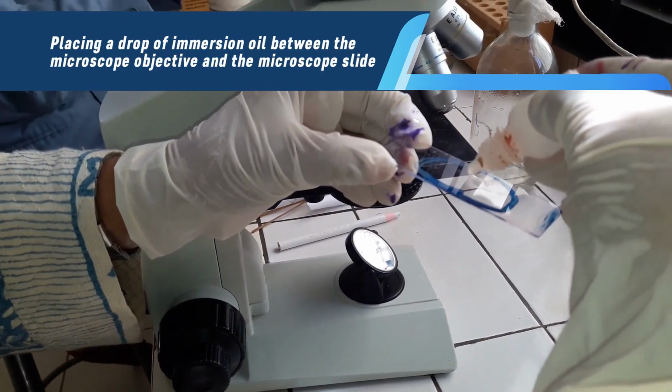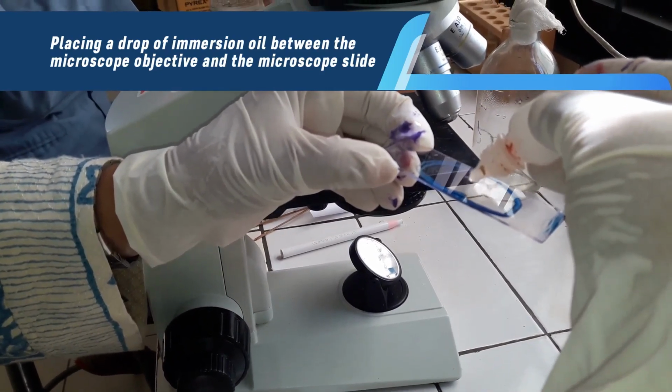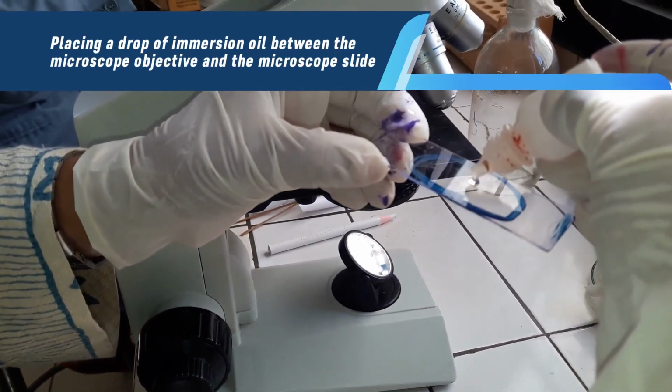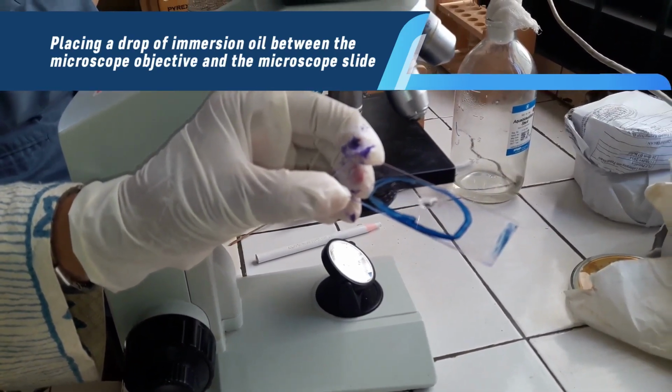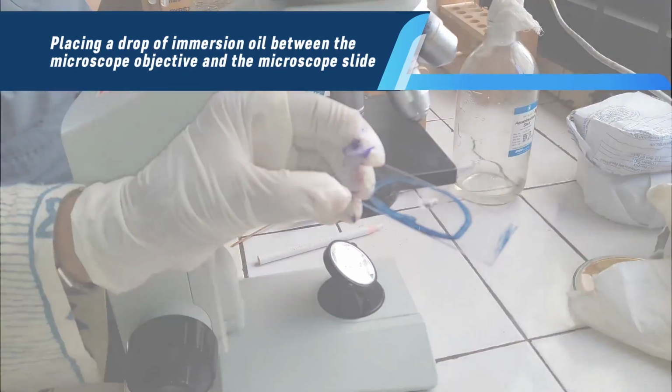The immersion oil has the same refractive index as glass, so the oil becomes part of the optics of the glass of the microscope. While oil immersion is not always necessary to see bacteria, it is often employed for higher magnification observation and enhanced clarity. The use of oil immersion microscopy is particularly beneficial when studying smaller bacteria and finer bacterial structures.